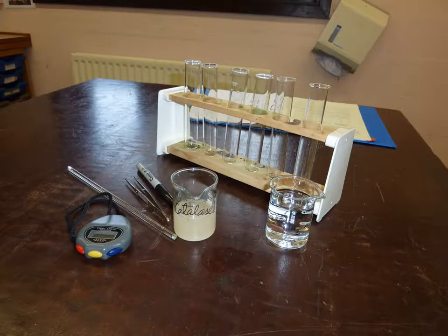So for this experiment the students put pieces of card, we used egg box pieces of an egg box, into an extract containing catalase. And the card will soak up the extract containing the enzyme and then it's transferred, each card is transferred into a test tube containing a different concentration of hydrogen peroxide. And then the time measured for the card to rise to the surface was made. And that's quite difficult because you've got to actually get the piece of card to the bottom of the tube first.